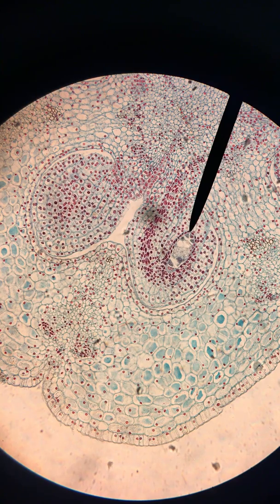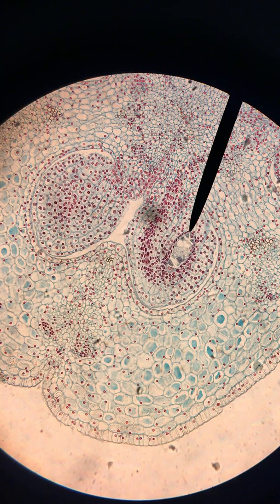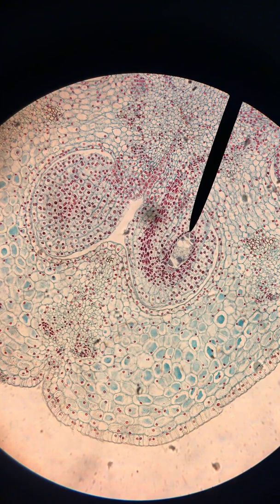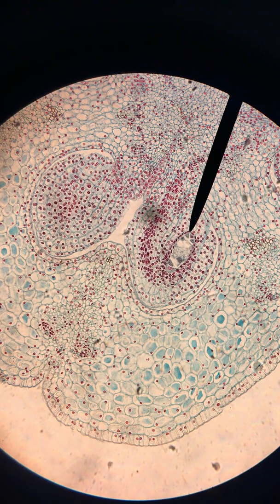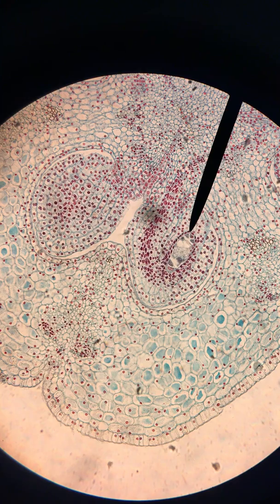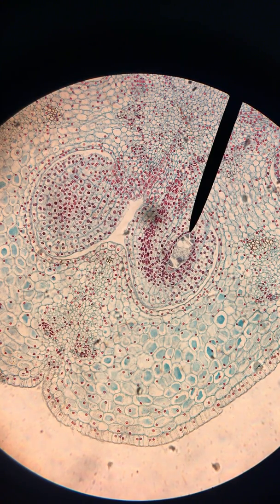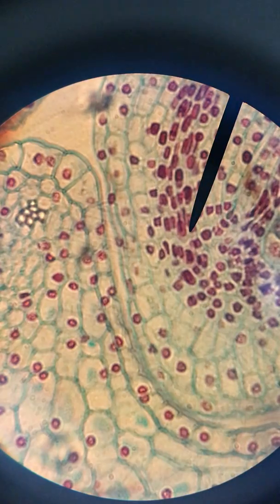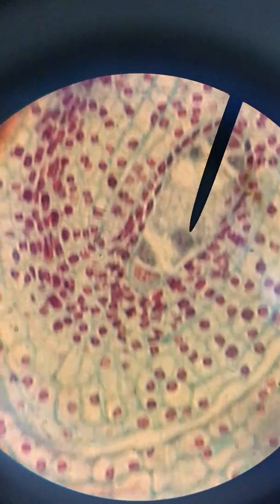So ultimately our mature embryo sac will have eight nuclei, and in this one we can see about seven. It is very difficult to find in one embryo sac all eight very clearly, so this is probably about the best we're going to see. We're going to increase our magnification once more to see all seven or eight of those as clearly as possible.